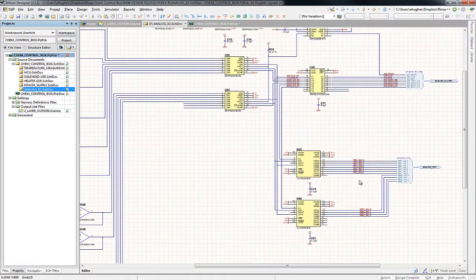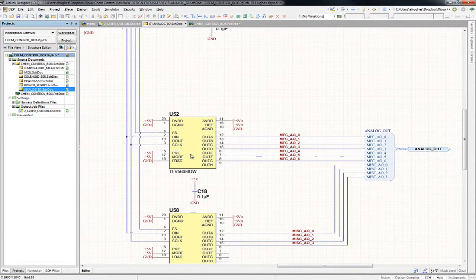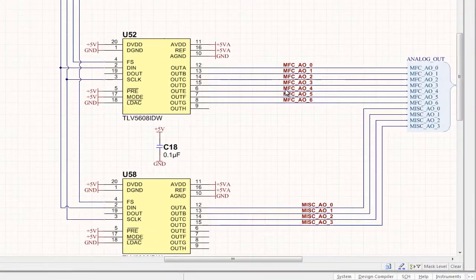But I just wanted to point out where the voltage is. There are some D to A channels as well for the analog outputs, for both the mass flow controller and the analog outputs. Once again, you're going to get a nice driver that does it all. You don't need to worry about the details of how the Embed talks to the D to A's and A to D's. It's just going to do it for you. That's what I've provided.